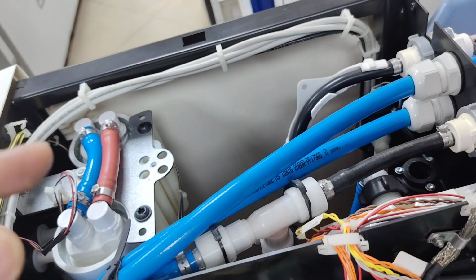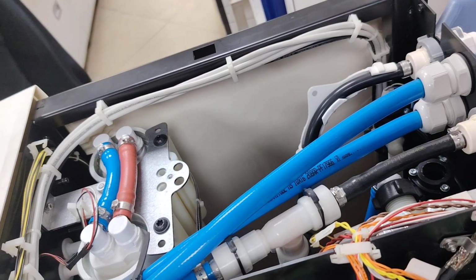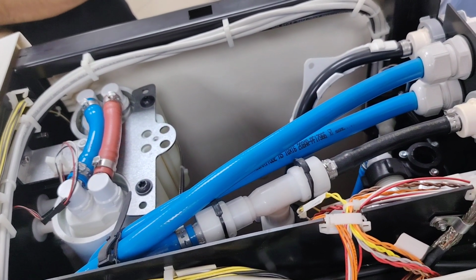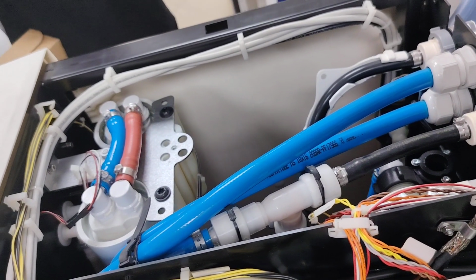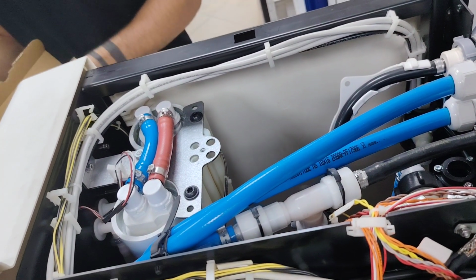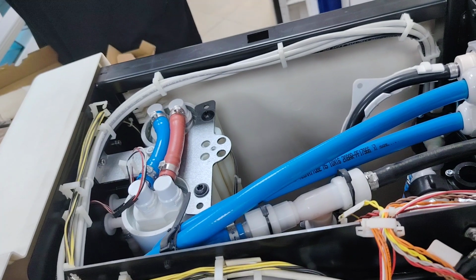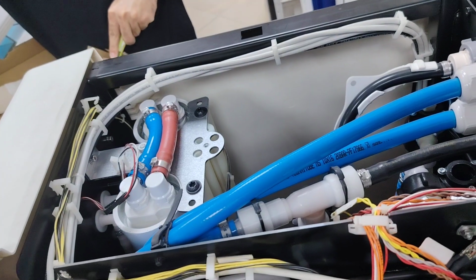There is a lifespan of that UV light. It's usually about one, because this is only the first time we replace it since we installed this machine. At the top, with no external factors at all, optimum is around 2 years. 2 years? If we're talking about optimal settings, everything in top shape. Usually, sometimes you replace them every year.